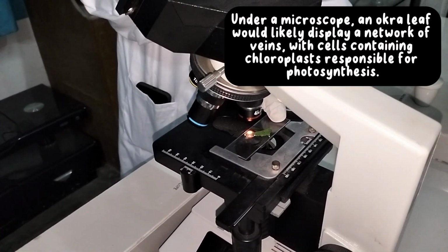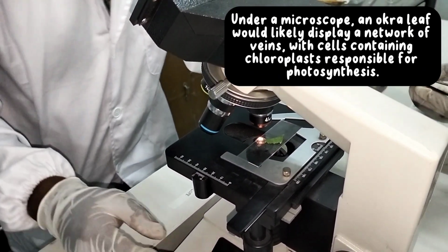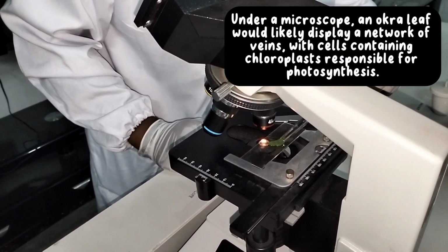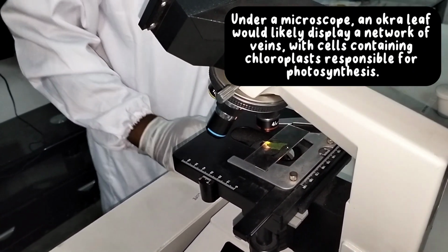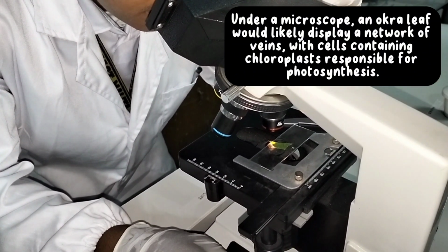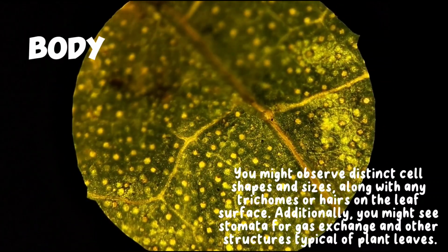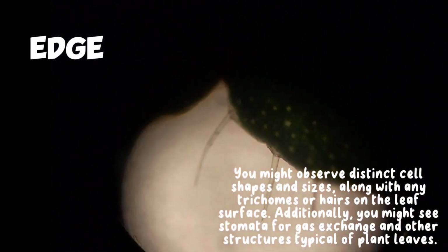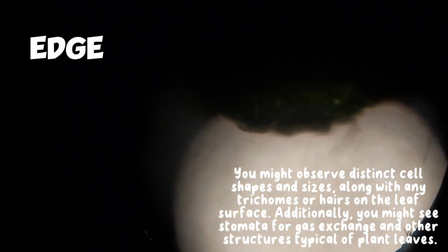Under a microscope, an okra leaf would likely display a network of veins, with cells containing chloroplasts responsible for photosynthesis. You might observe distinct cell shapes and sizes, along with any trichomes or hairs on the leaf surface. Additionally, you might see stomata for gas exchange and other structures typical of plant leaves.